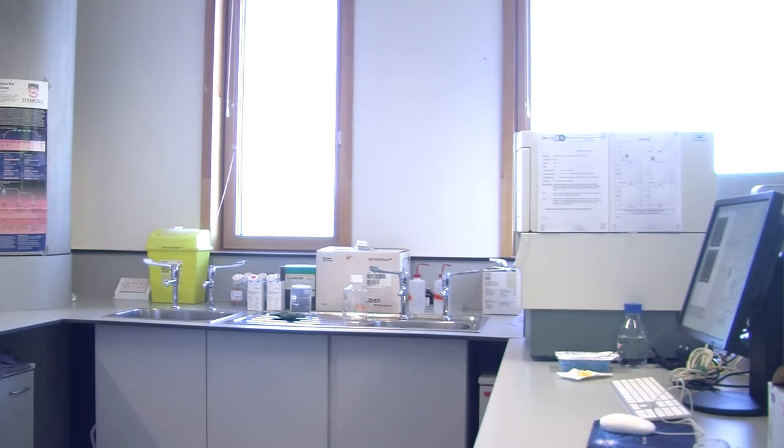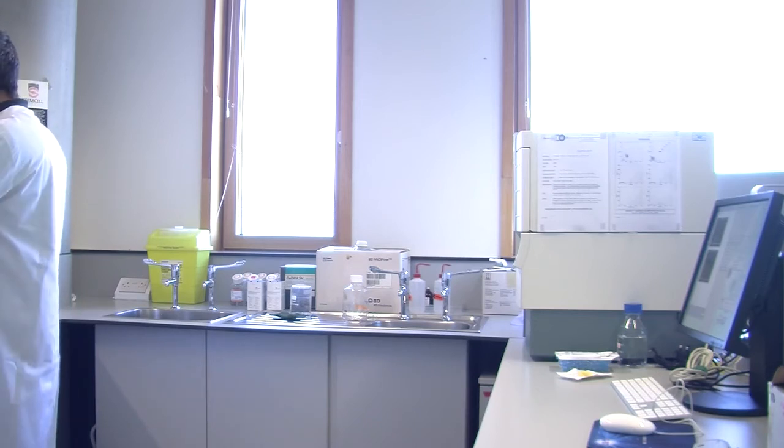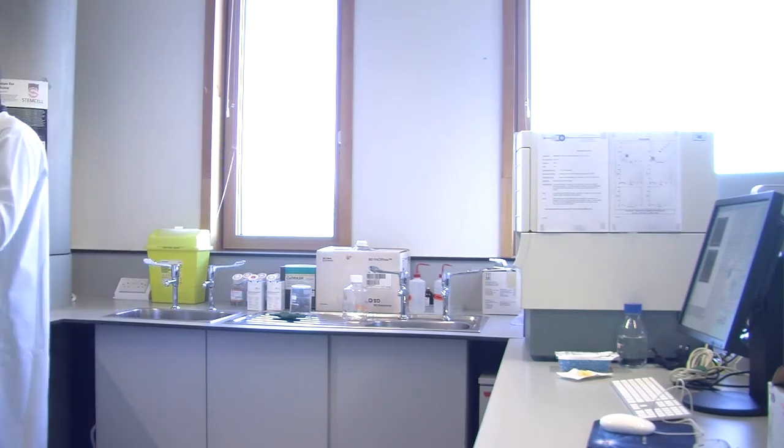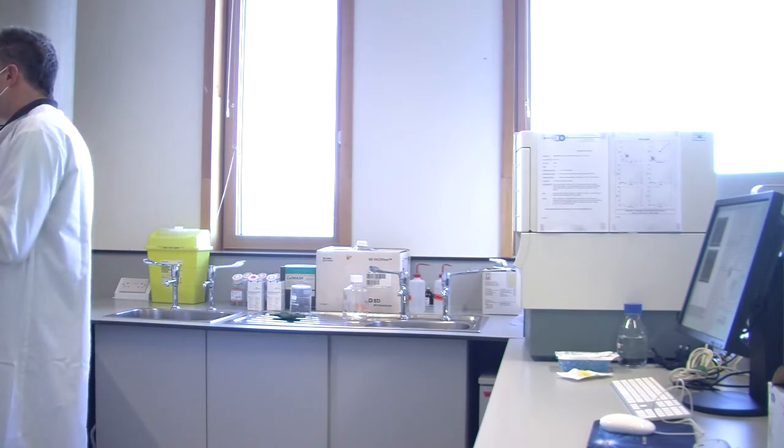Did you say the isotype control is less sticky than the... No, the isotype matched control should be exactly the same stickiness as our actual antibody. That's why we use the different peaks? So, when we run our isotype matched control, say there is this much fluorescence. When we run our actual antibody, if it's in the same place, we have none of that protein on that cell. But if it moves to the right, it means there is more of it. More protein, because we have more fluorescence with the actual antibody than we do with the isotype control. Okay.